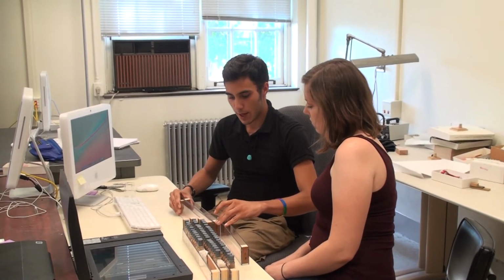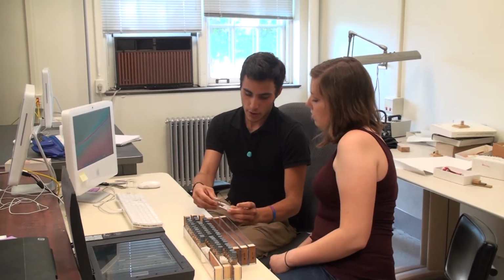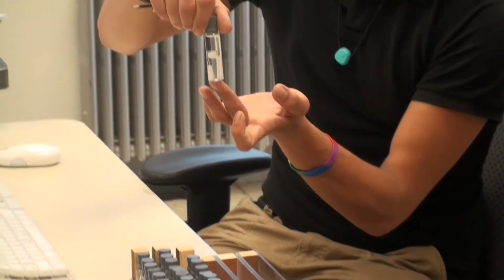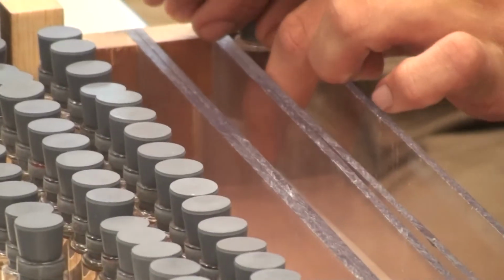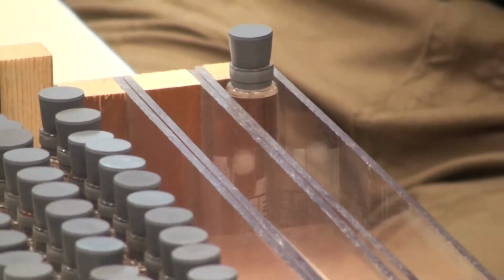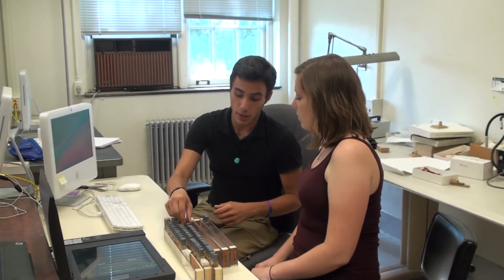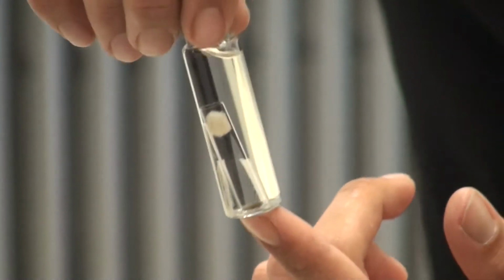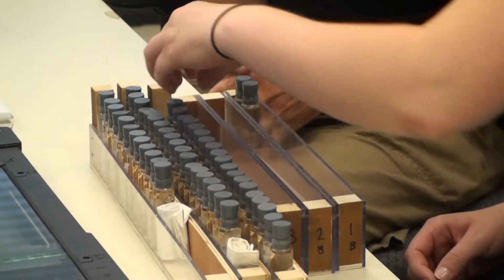So we can begin to fill these up, starting with number 1 and transferring them here. Now we want to make sure that we try and orient all the labels to one side. So you see here we've got this nice big locality label. We want to get that on one side of the tray, and we want to make sure we orient all the other vials similarly so we can get all the label data on one side, and then on the other side we can get a little bit of a specimen image as well as any other extra labels. As you see, there's sometimes extra identification labels as well as our UIDs floating around. So we want to get as much of that data as we can using this process. Okay? We can begin to load them in.